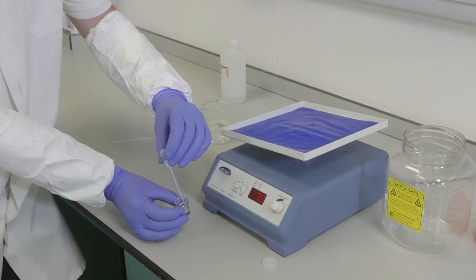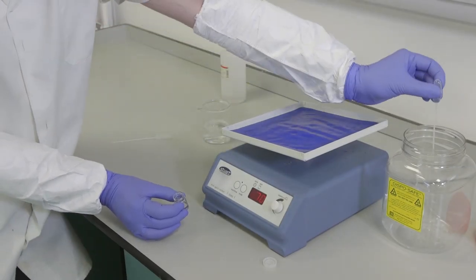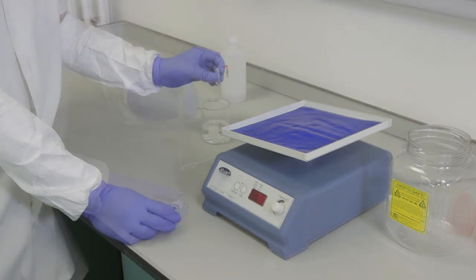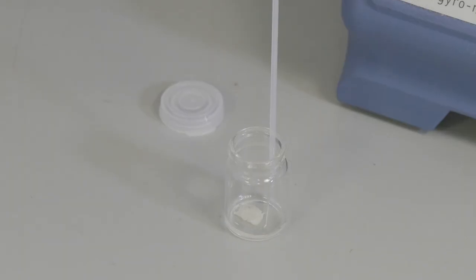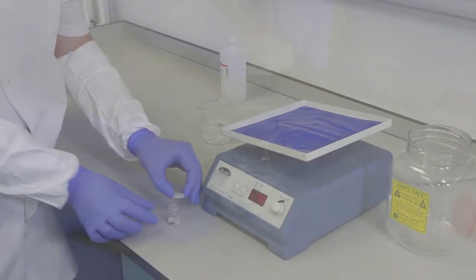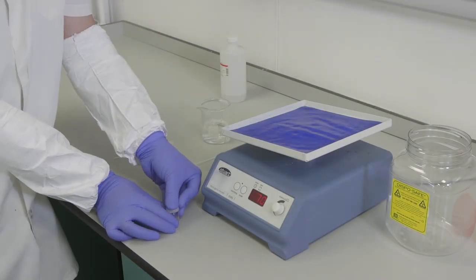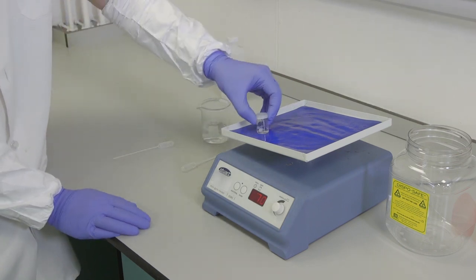Carefully remove the 4% PFA solution without disturbing the brain slice. Wash it with the 1% Tris Triton solution for 10 minutes under agitation. Repeat this step 2 more times until you have performed 3 washes.